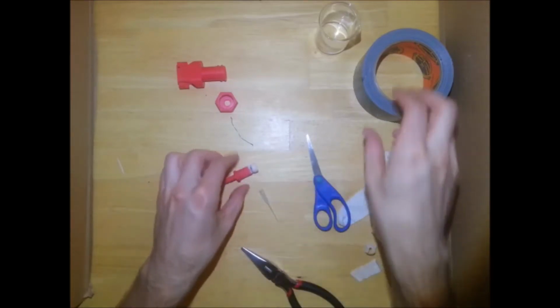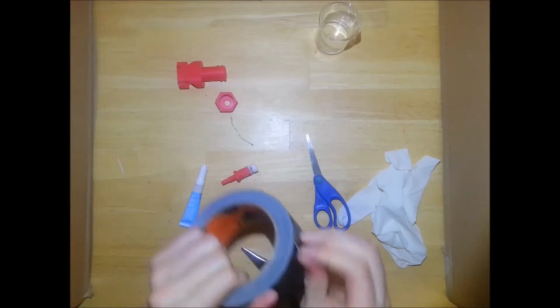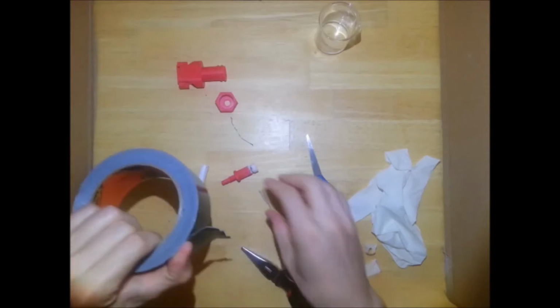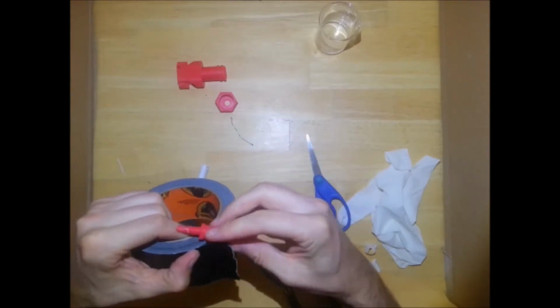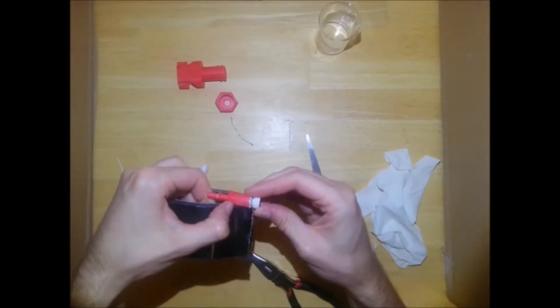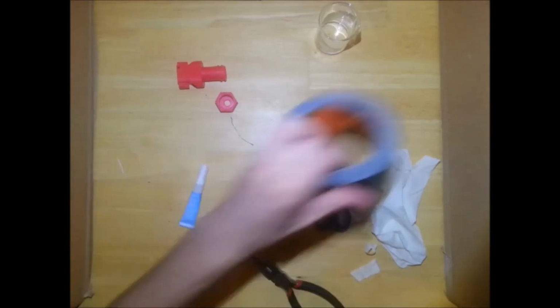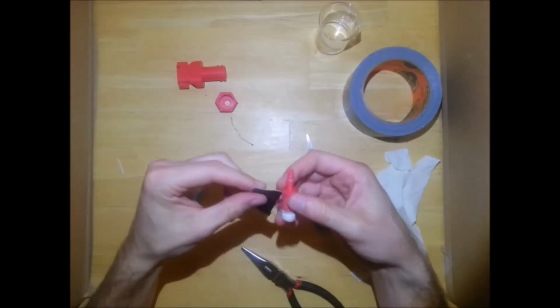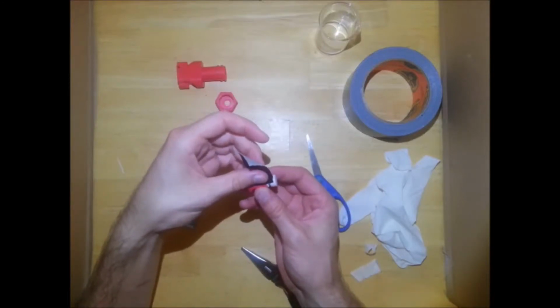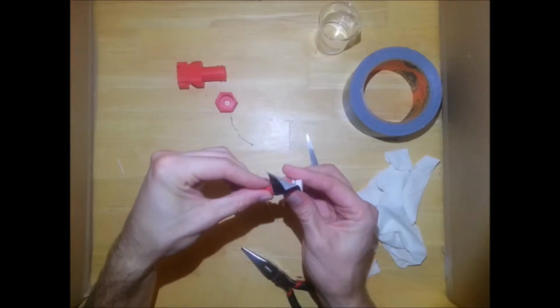Once that's done, you want to take a piece of tape. Gorilla tape works excellently. You want to take enough that it covers this top portion up to about here. And you want to make it so that the tape goes just up to the top, but does not go past the top.